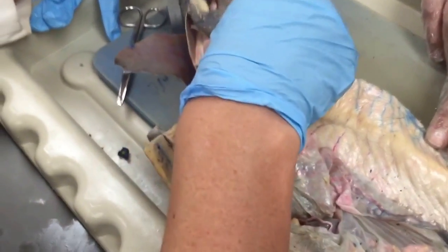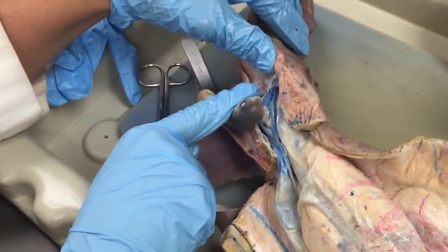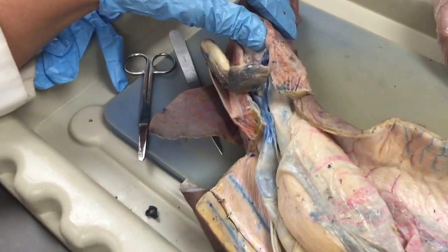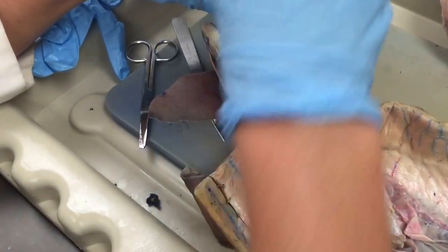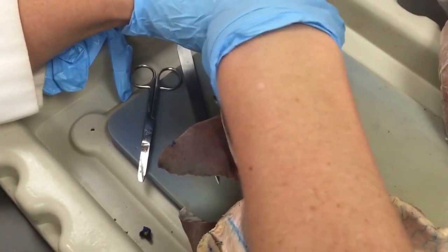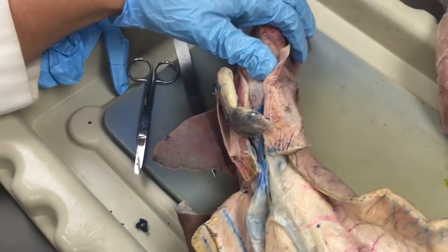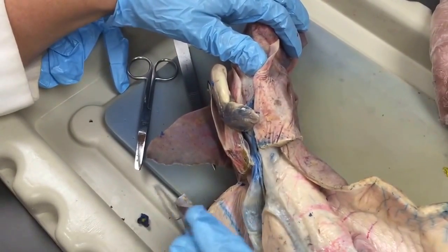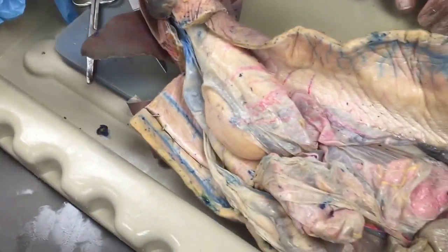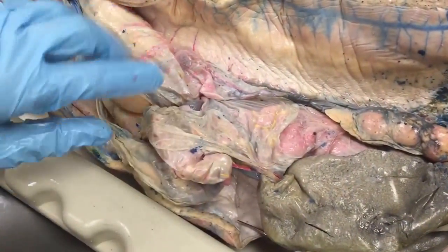When little baby sharks are born, they exit through the cloaca here. The papilla there just has a urinary function, and the space that the uterus empties into — if you stick a probe up, that goes into the uterus — that space there is the urodium. The coprodium is the space where the fecal tissue exits from the digestive system, so like the space around the urinary papilla. That's the reproductive side of the urogenital system in the female.